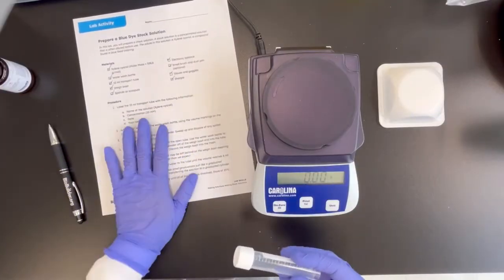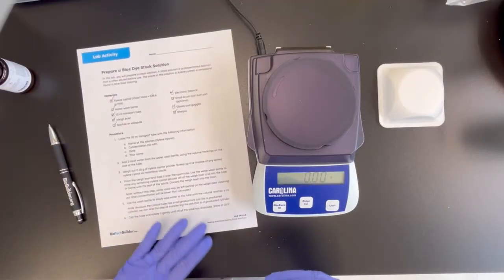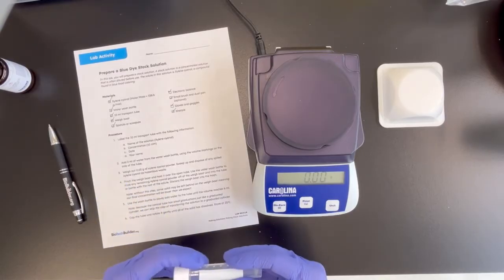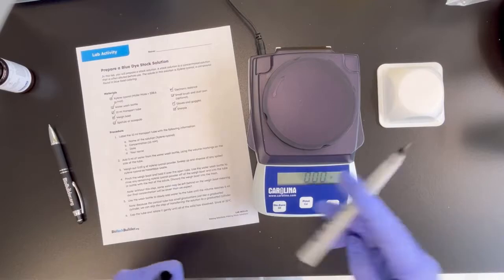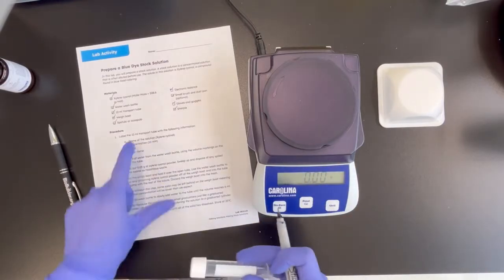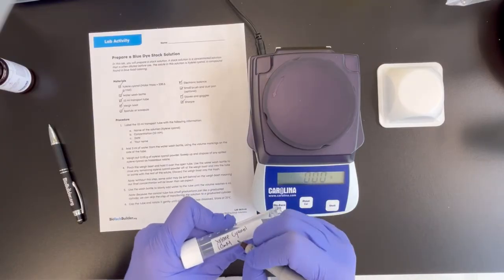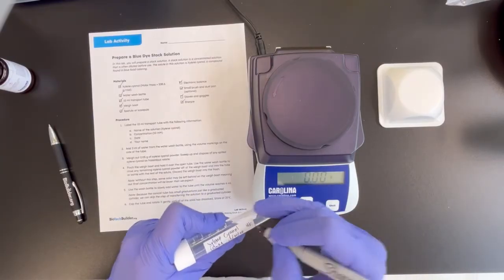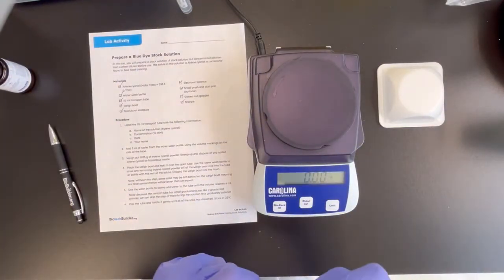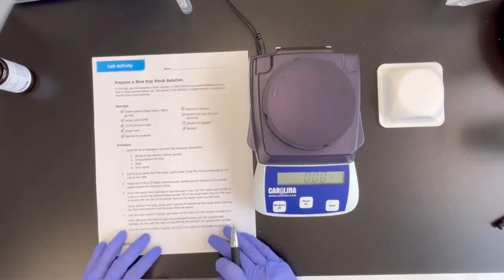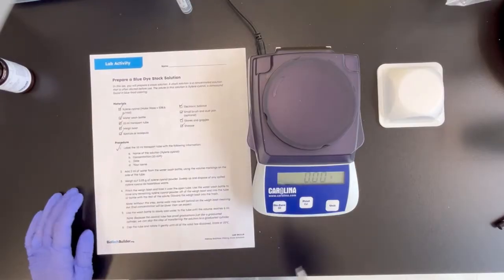So the first thing, the protocol is laid out so that in the lab skills portion many of the steps about labeling are individually written out. So the first task is to label the 10 milliliter transport tube with information. And we've completed step one.